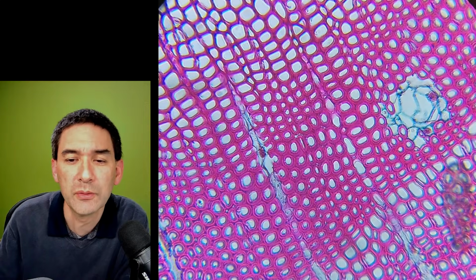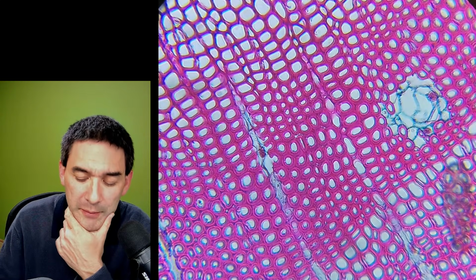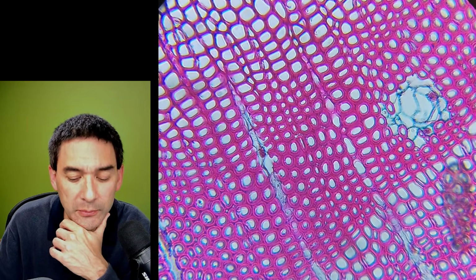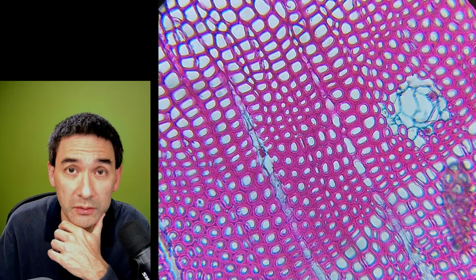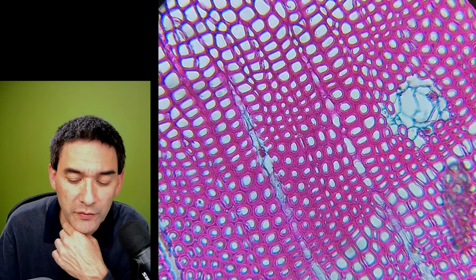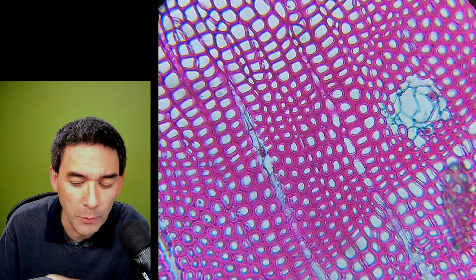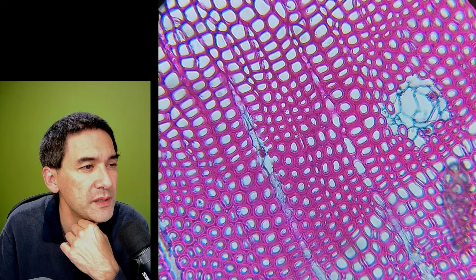Yeah, similar to the Telmo in construction. Yes, I just want to say the following. Those microscopes are all very, very similar. And I think some of them are so similar that I even think that they're made in the same factory in China, because the parts are so similar. However, the Telmo microscope is a little bit different to this one over here, because the Telmo microscope does have smaller optics. So I think the optics here are slightly better. I can actually show you the desk view over here. I'm just gonna flip it over.